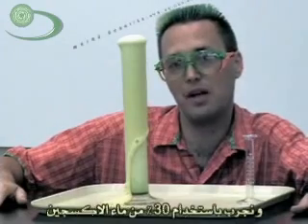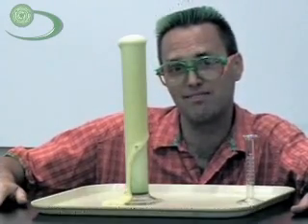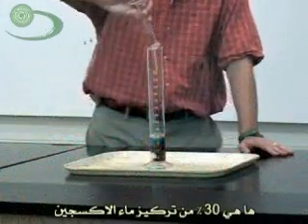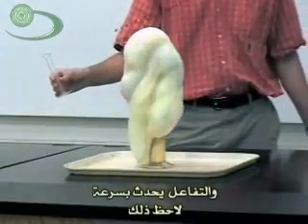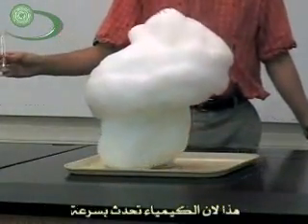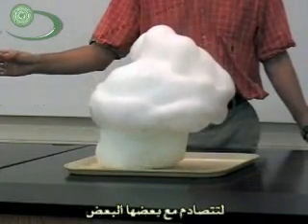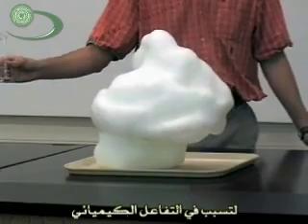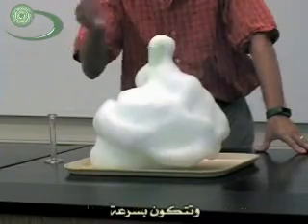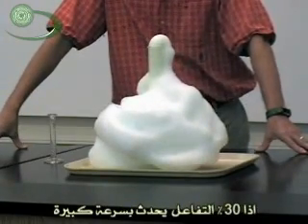So we're going to clean this up and try it with 30% hydrogen peroxide. 30% hydrogen peroxide is much more concentrated, so it should happen faster. Look at how fast it's happening! That's because chemistry happens faster because there are more molecules present that collide with each other to cause the chemistry to happen. When this reaction happens it causes bubbles, so we get lots of bubbles when it happens fast. 30% — it happens really fast.